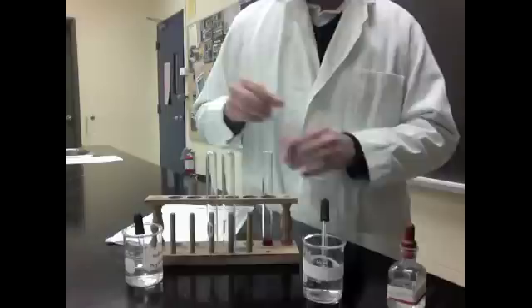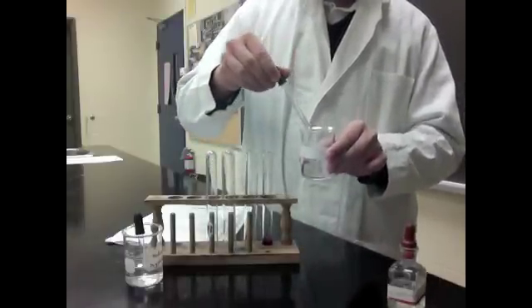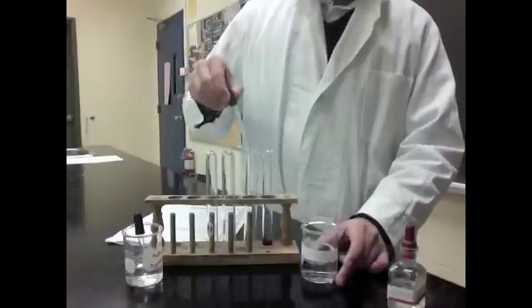Then you take another test tube and take two eye droppers of sulfuric acid into the test tube.